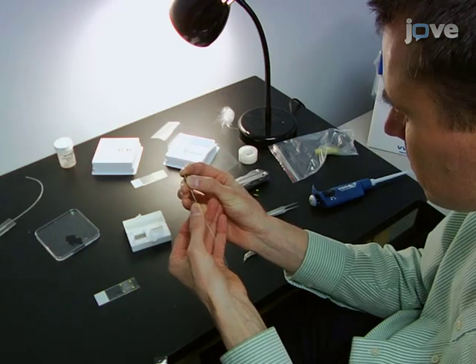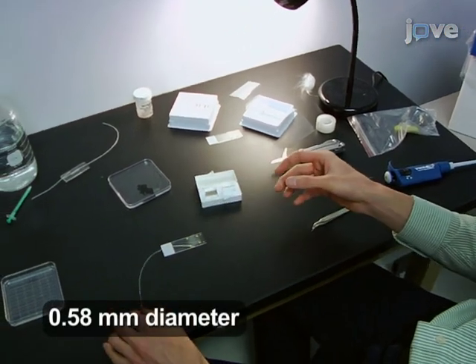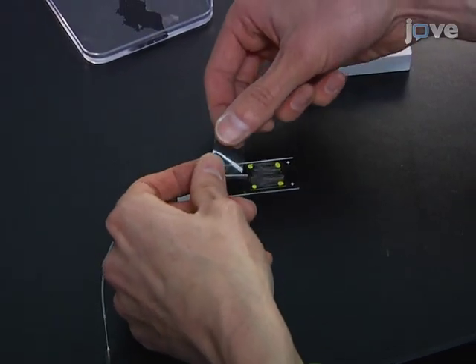After that, connect one end of the polyethylene tube to a 1 milliliter syringe and place the other end of the tube immediately adjacent to the chamber. Hold the tubing in place with tape.